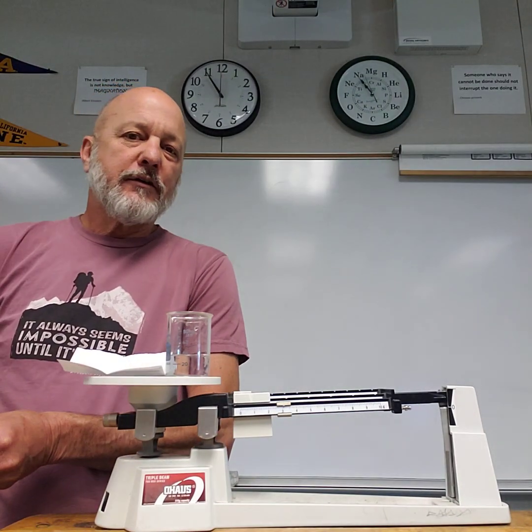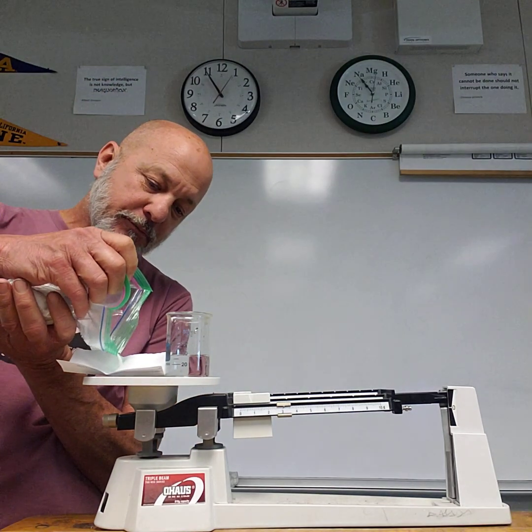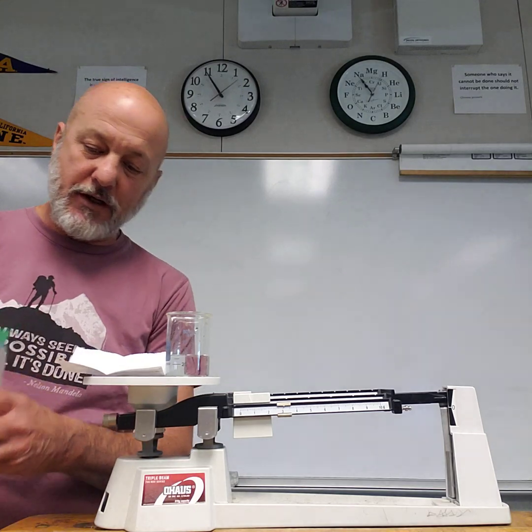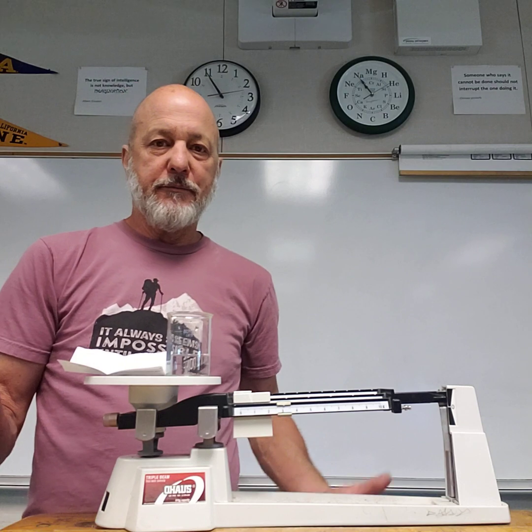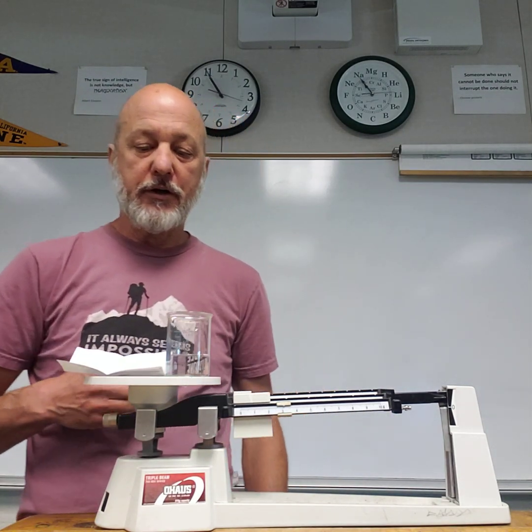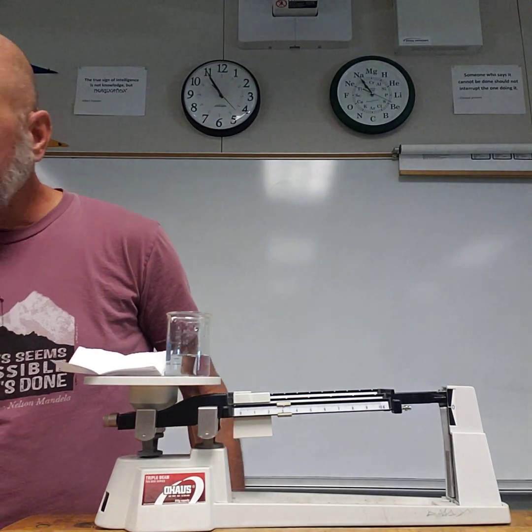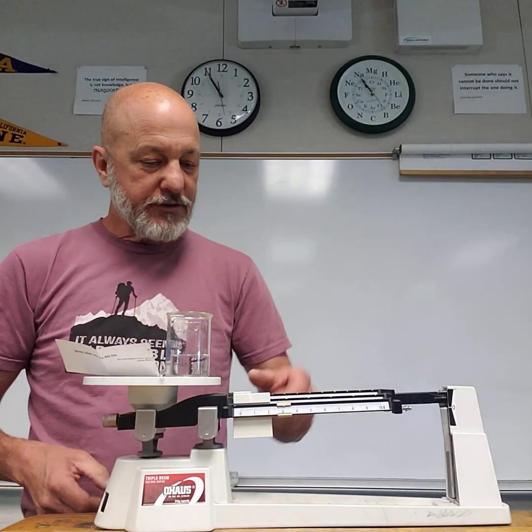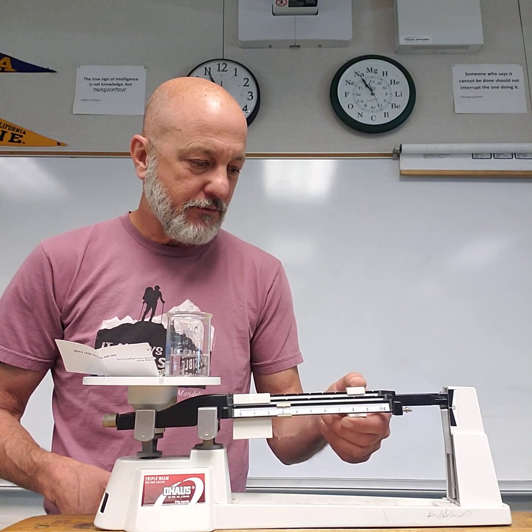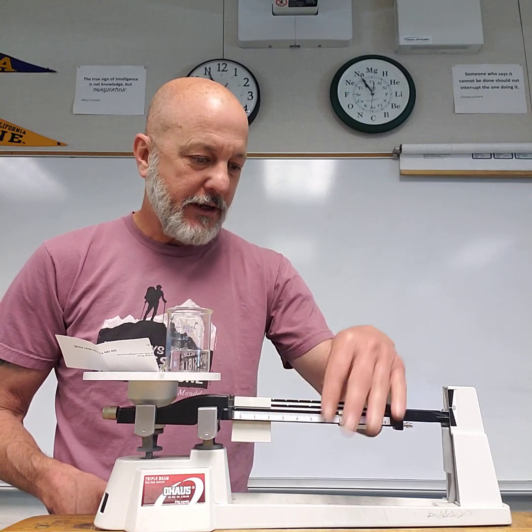One of the reasons, of course, obviously you know what happens when you add sugar to water, so why are we doing this lab? Part of it is to practice our representations of what's going on, our lab skills, thinking about what we're doing with the lab, and then what is actually happening at the particle level, and can I represent that with a particle model. So now I'm going to weigh the stir rod and explain the reasons for that. I weigh all of this together, and I'm not going to go through the whole thing on the video, and I find the mass.